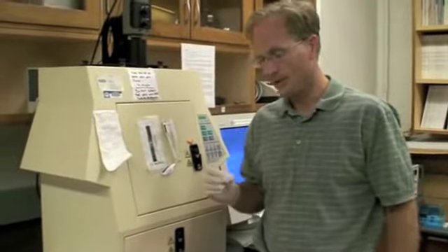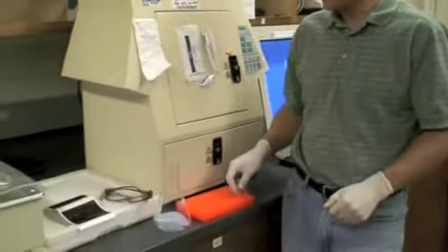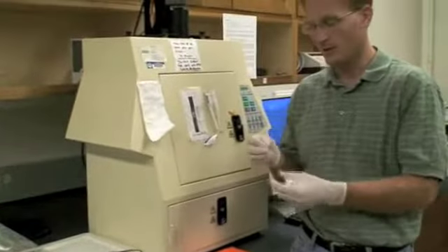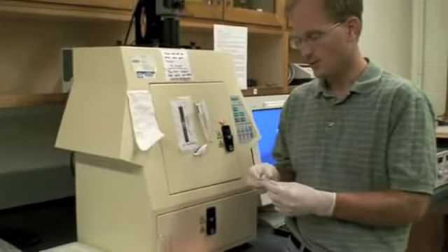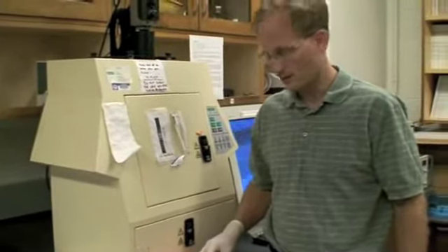And so it's good to do the cuts quickly, get it done with, and get the fragments out into tubes so we don't have any mutations in these fragments.